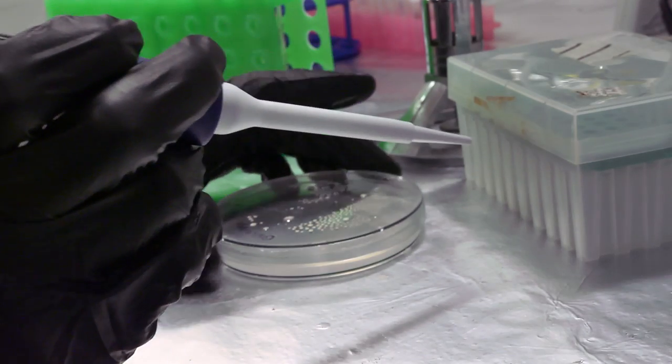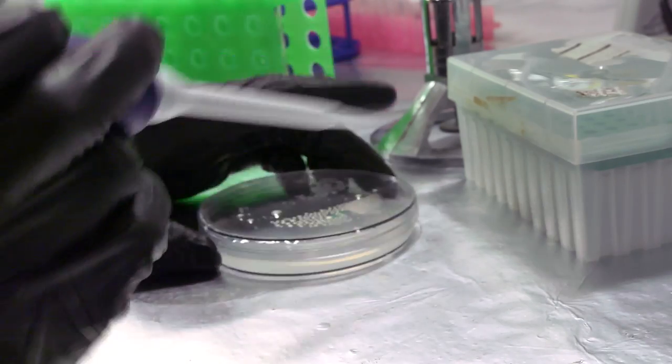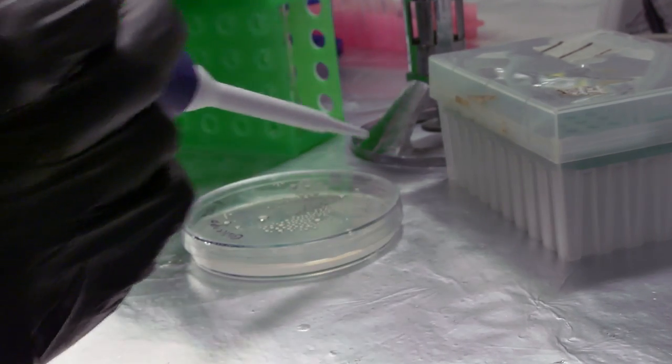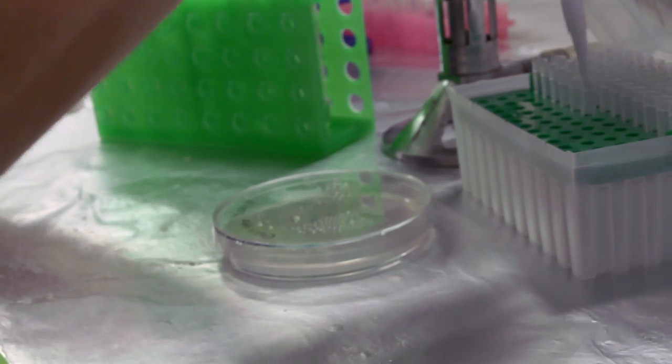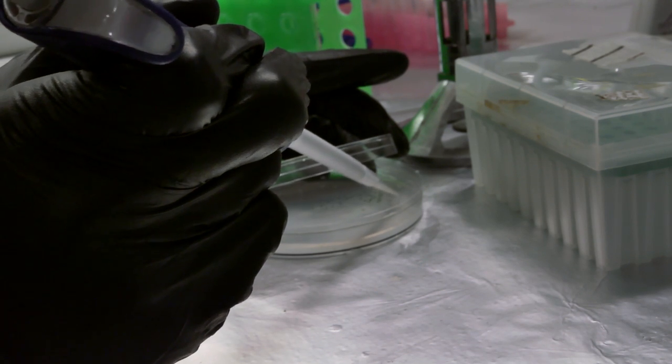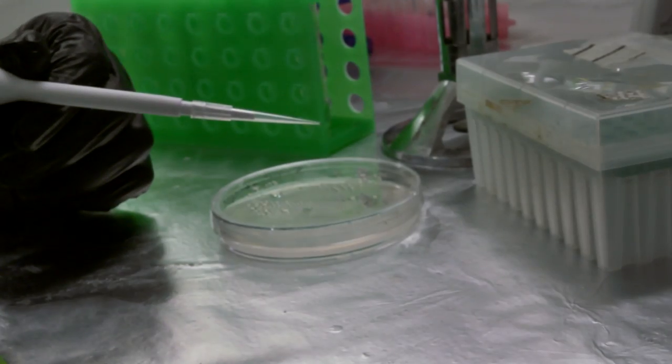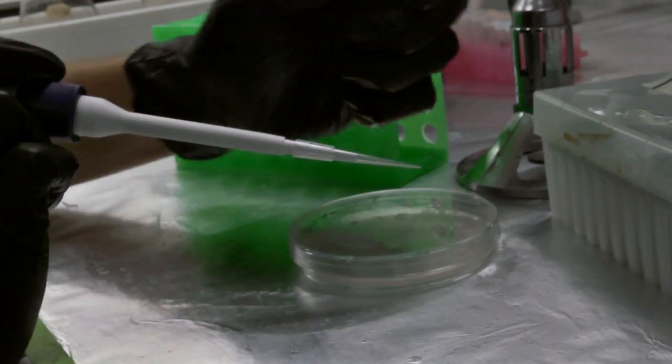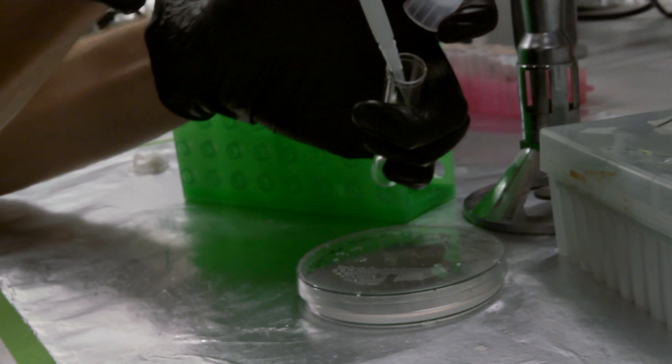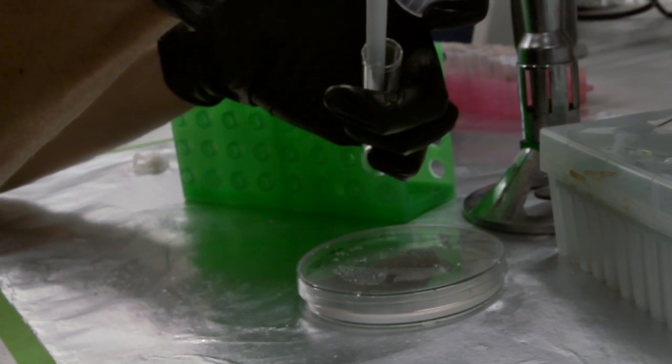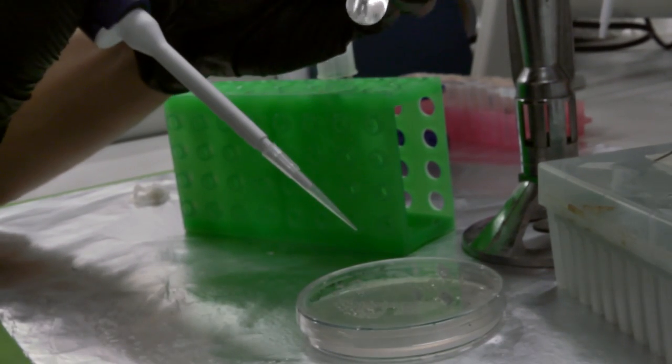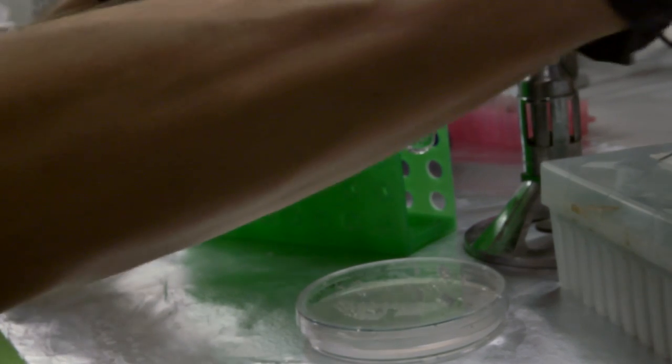There's definitely many ways to go about doing this, but basically I'm going to just go in with a pipette tip and try to swipe the colony up and then pipette it down into the medium here, so we'll see if I can't grab these. It's a little bit hard, and I'm trying to do it with minimal exposure to the air. Okay, there we go, so I've got the colony there on the tip of the pipette, so I'm going to come in here and just dab it into the tube, which, well, I should keep it over here by the flame, but I'm going to dab that in, pipette up and down a couple times to make sure I got the green colony off the tip, and so obviously I can't see it in here because it's pretty dilute, but I can tell it's not on there anymore, so succeeded at that.